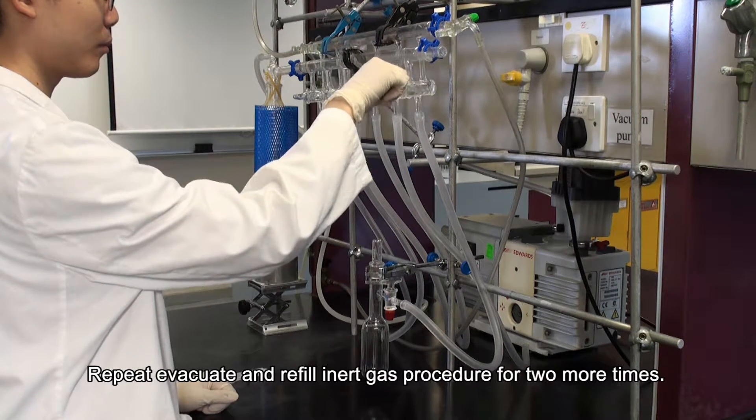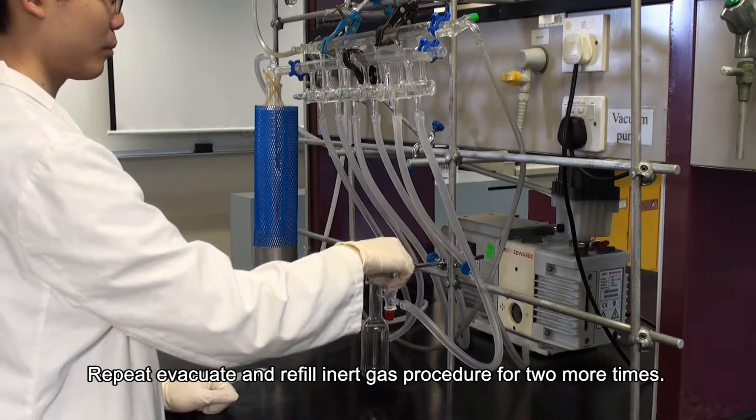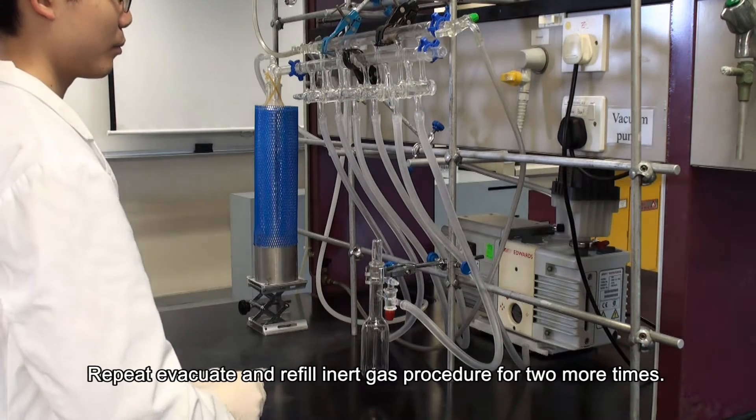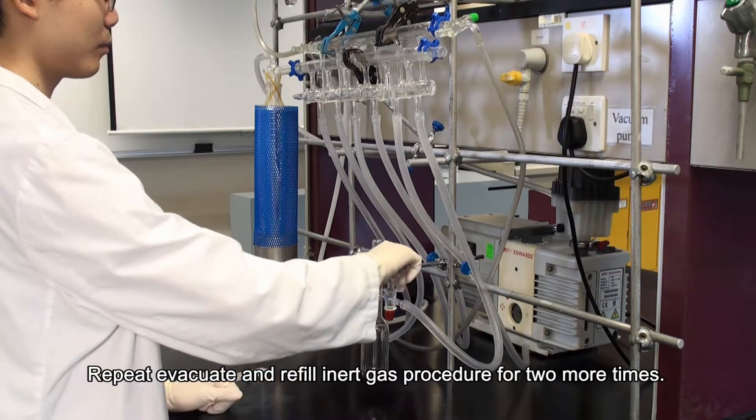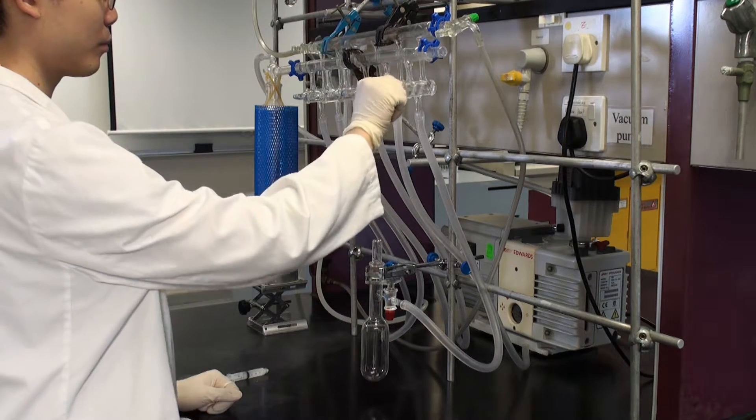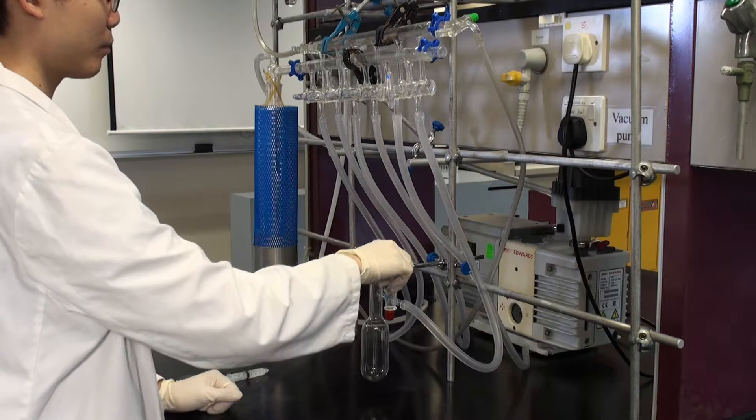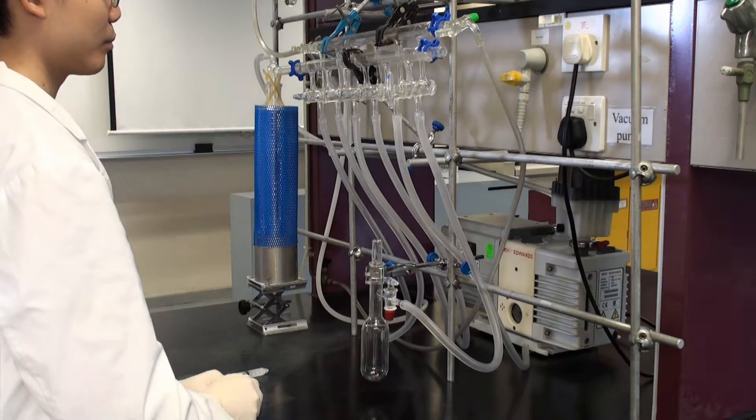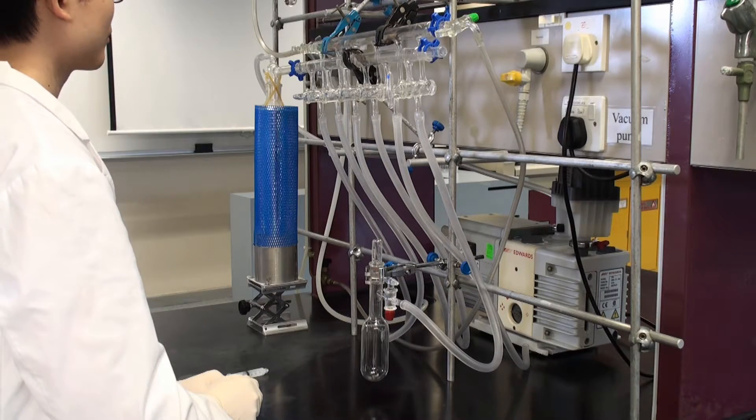Repeat evacuate and refill inert gas procedure for two more times.